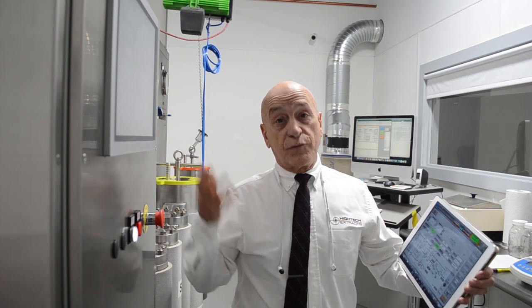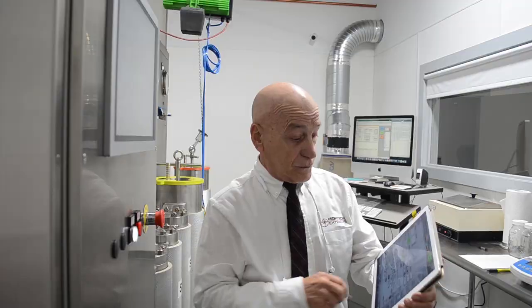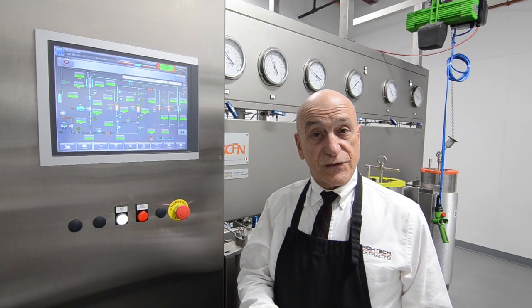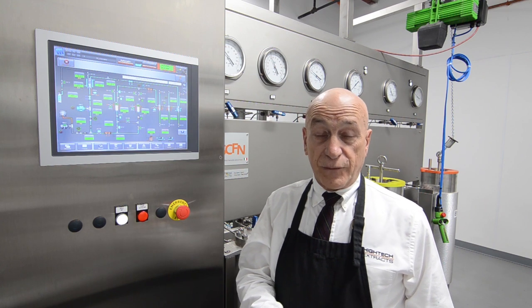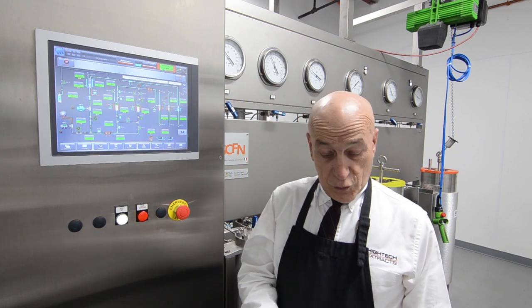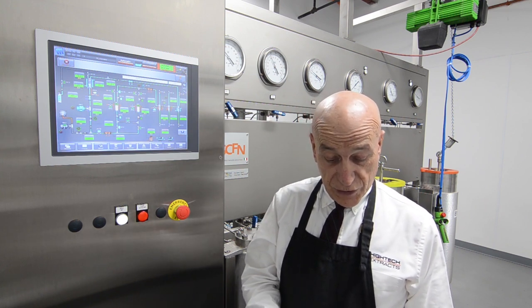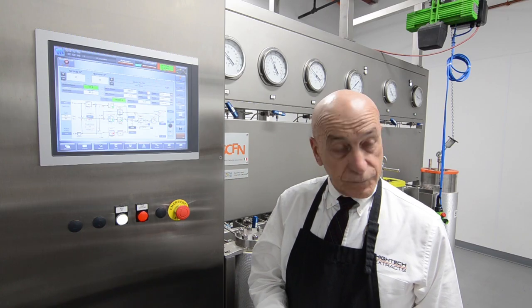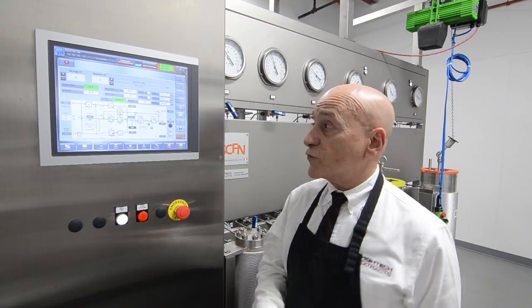To demonstrate remote access and control from a smartphone, we're going to go and change the flow rate. And enter it. And now it's off and running.